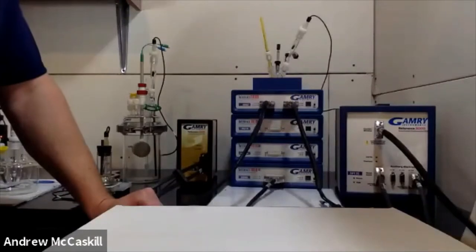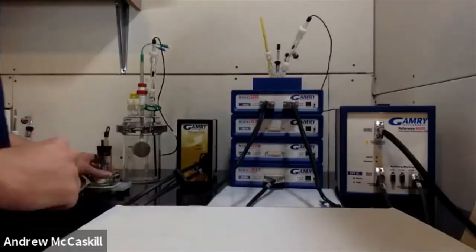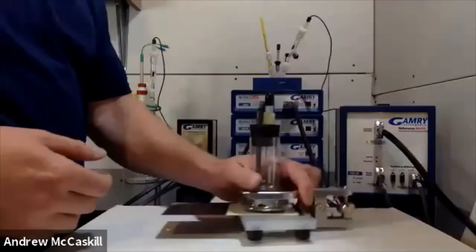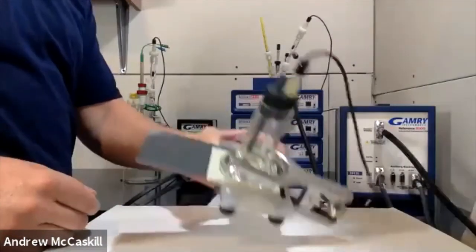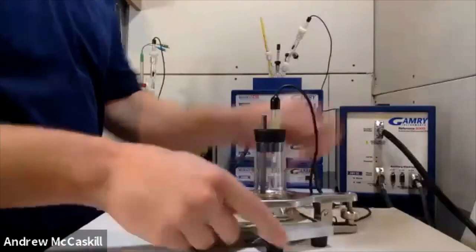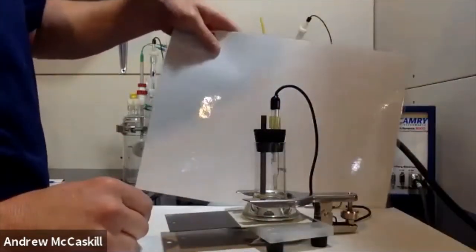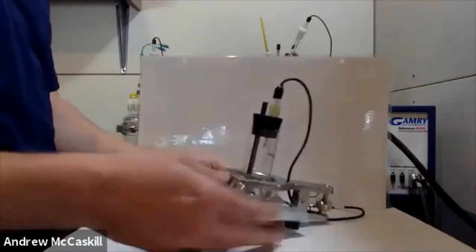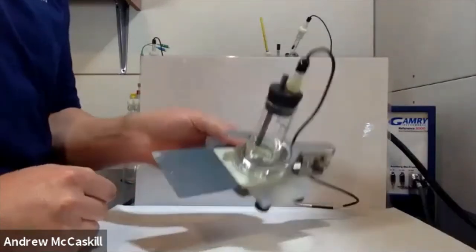The first cell I wanted to show is one of my favorites — probably one of our most elegant cells. It's the Paint Test Cell, the PTC1. This cell is primarily designed for testing coated samples. You can see right here I have a coated sample; I scratched off some of the surface to expose the metal beneath.